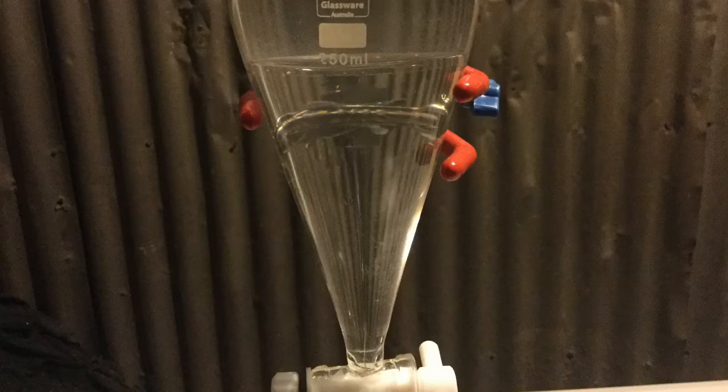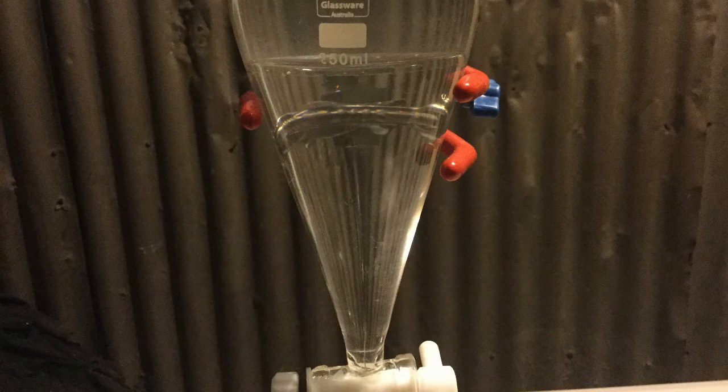This is what the much cleaner, clearer DCM looked like after the washings. It's the bottom layer.